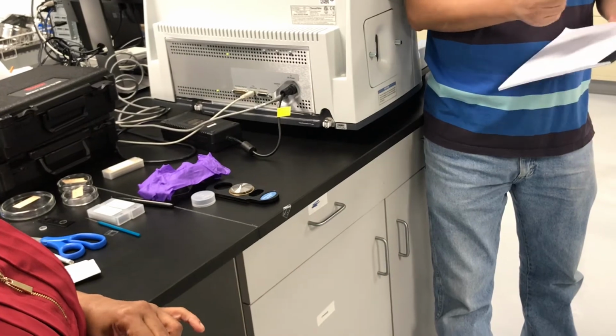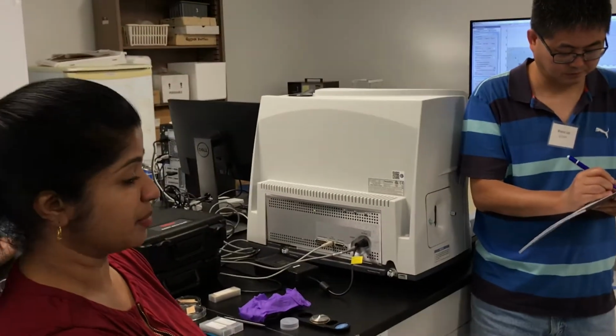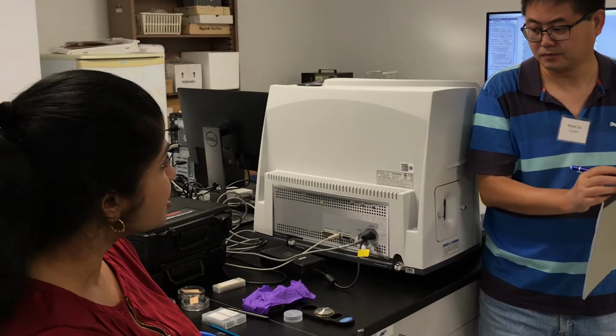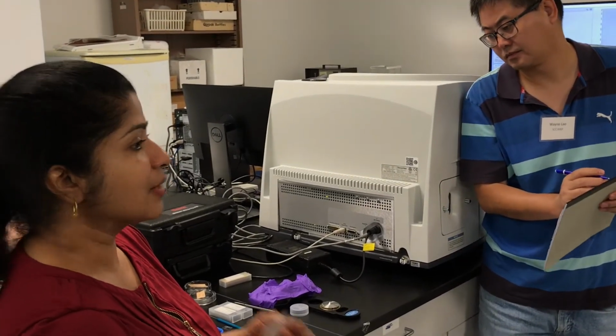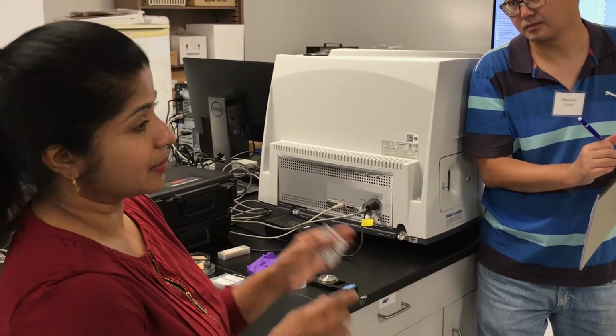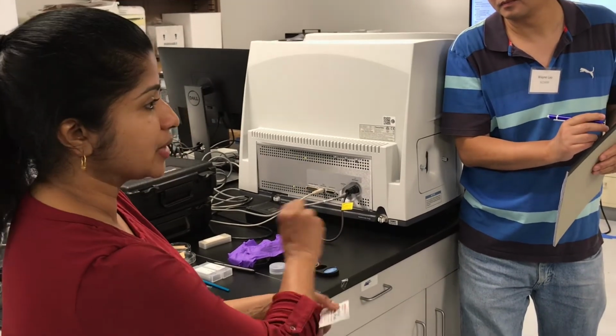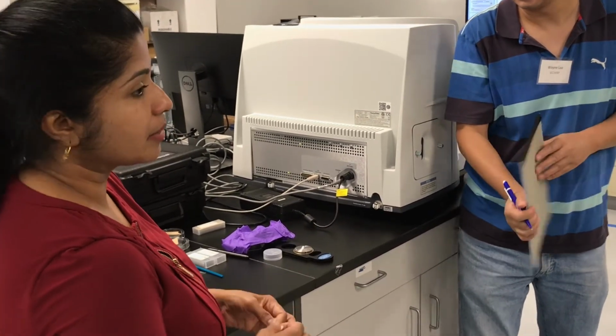Those are the ones that are there in the semiconductor clean rooms. They use those. Those are bigger too. I don't know if there are smaller versions. I don't have any in my lab, but I have seen in all the semiconductor clean rooms these big lens cloths with IPA on them. So think about it, but it's IPA.